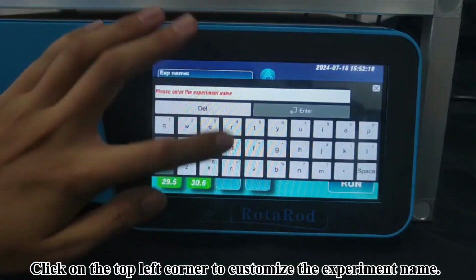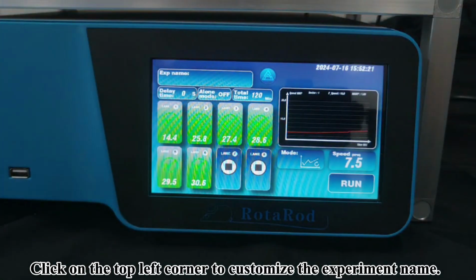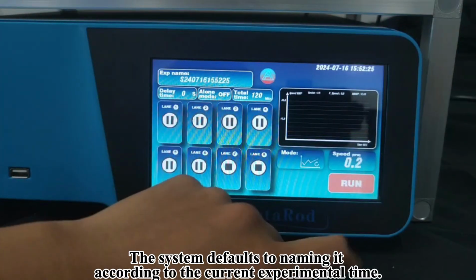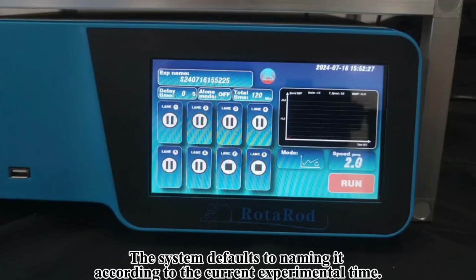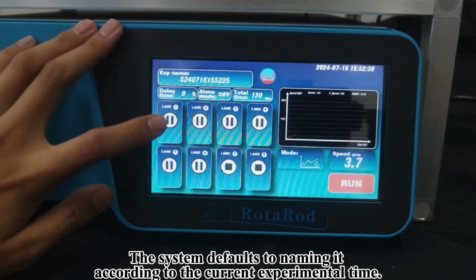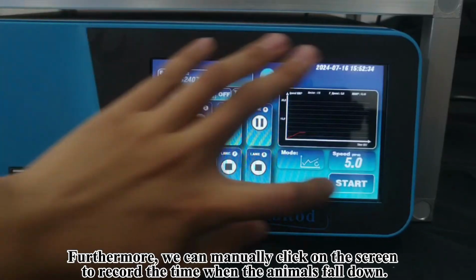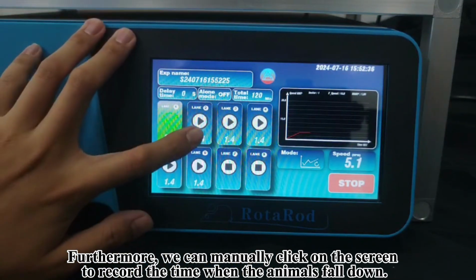Click on the top left corner to customize the experiment name. The system defaults to naming it according to the current experimental time. Furthermore, we can manually click on the screen to record the time when the animals fall down.